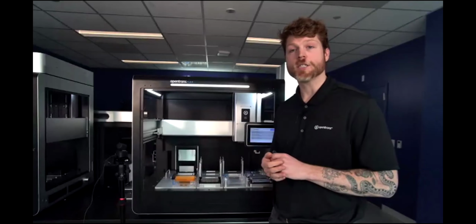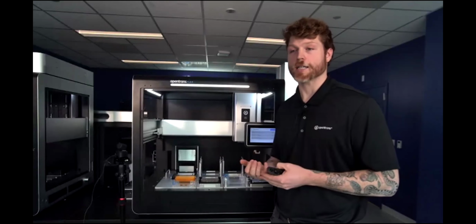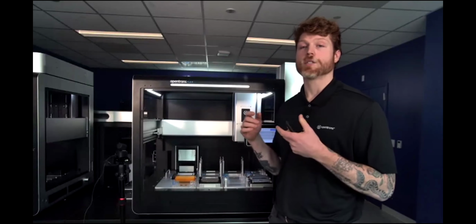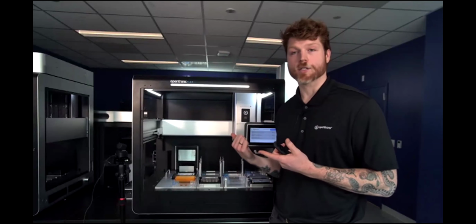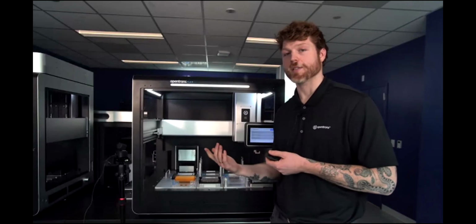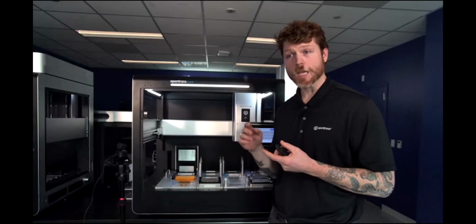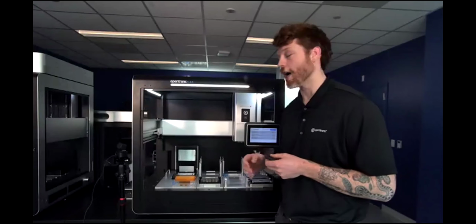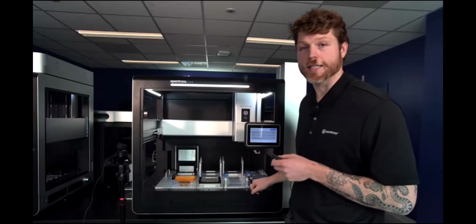With that, as Matt had mentioned, currently we do have a rule that it is best practice to have one type of labware per stacker. For each stacker, you would have the ability to store tip racks. As I'll show here, those tip racks can be lidded or unlidded, using the Flex gripper to then remove those lids if you have them on there. You have the ability to add up to 7 more tip racks, so that will be 6 within the tower itself, and then 1 on the deck.